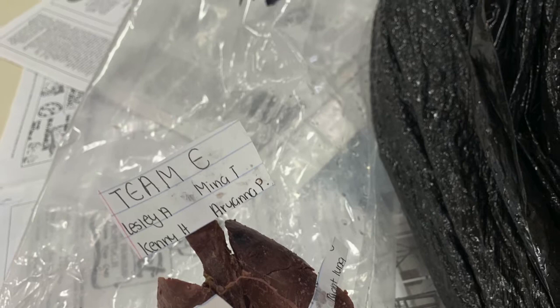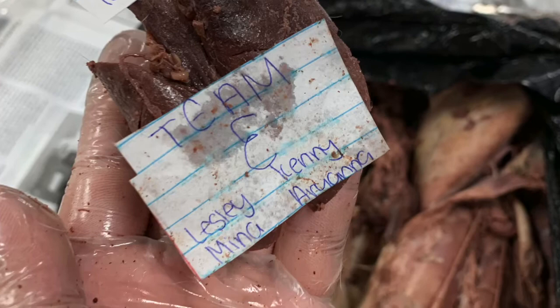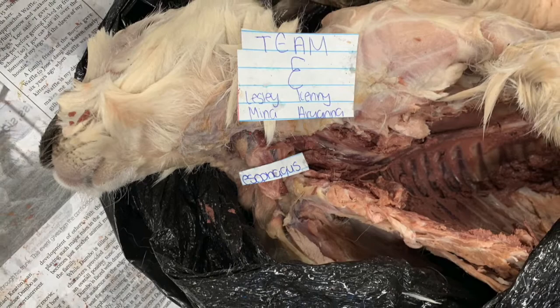The structures of the respiratory system include the nose, larynx, pharynx, trachea, bronchi, bronchioles, lungs, and most importantly, the alveoli, or grape-like structures. Functions of the respiratory system include the exchange of gases between the blood and external environment.